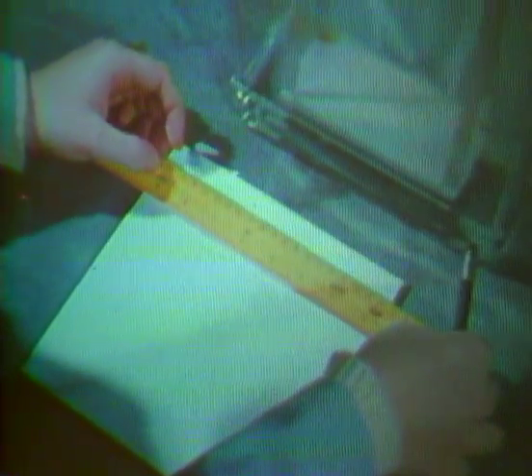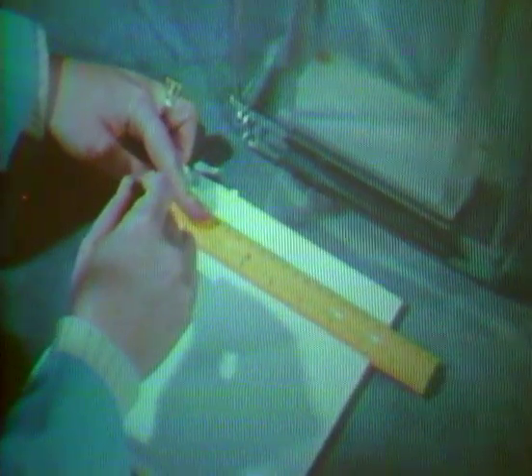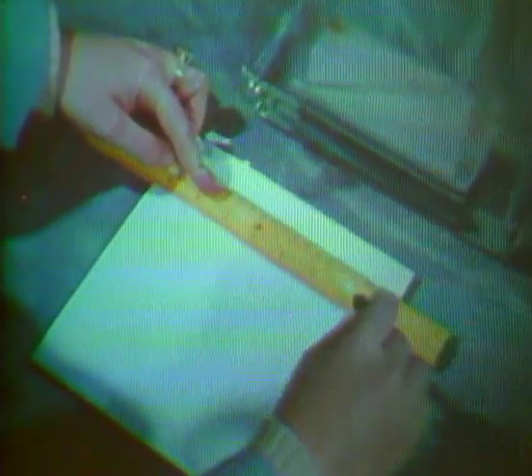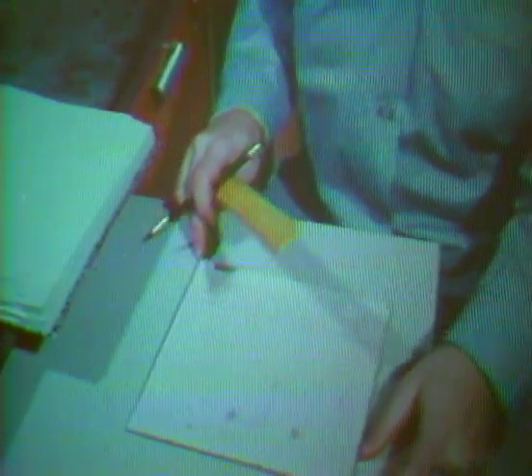The solvent front is marked before the plate is dried. To make the spots visible in this case, the plate is sprayed with ninhydrin, then heat treated. The spots are easily distinguished. The retardation factors are calculated to characterize the spots.